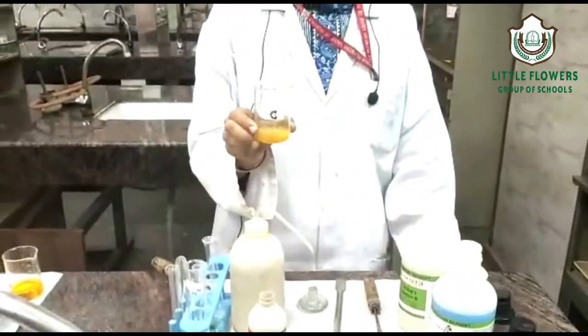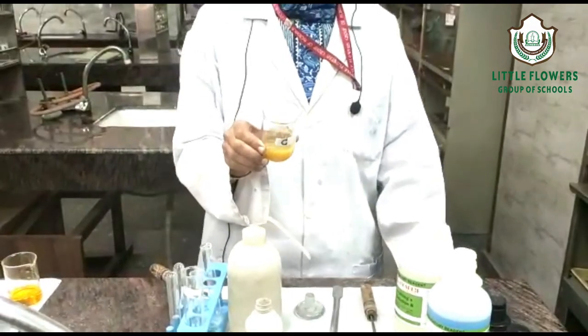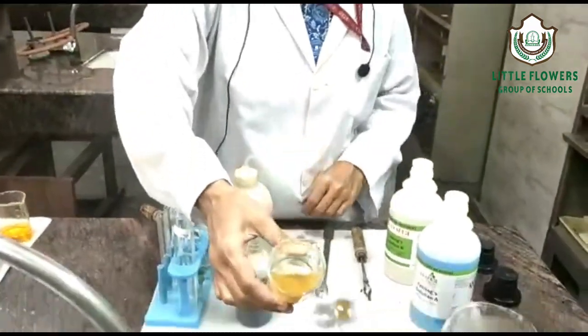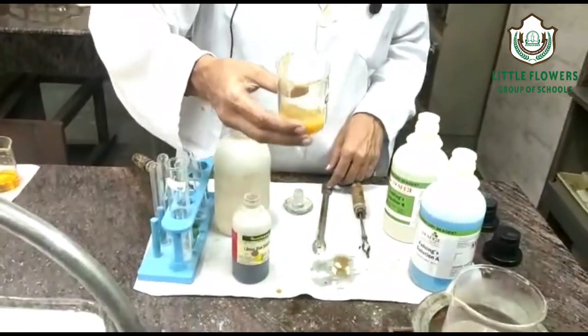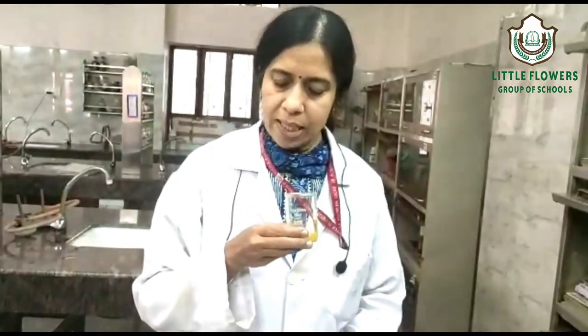We will do one more function group test. The aim is to identify the functional group in a given organic compound. Physically, if you observe this organic compound, it is slightly yellowish in nature, it is soluble in water, and yes, there is an odor present.